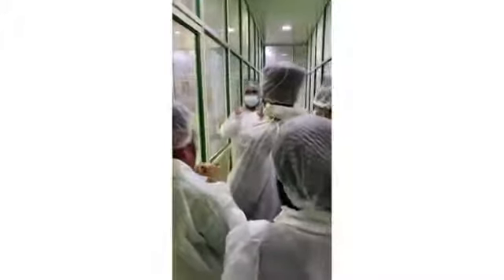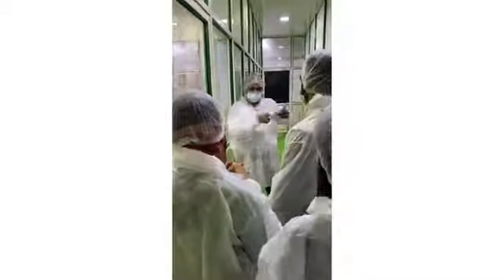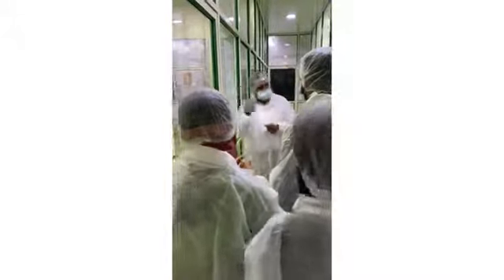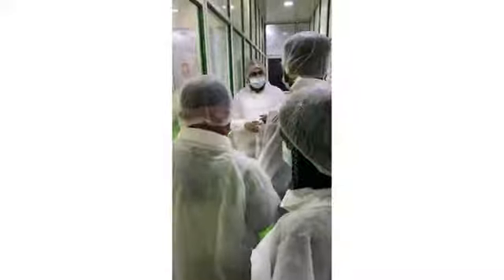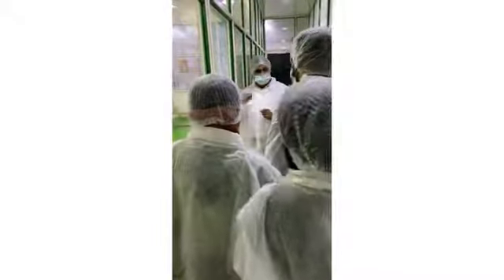We have to ensure that the food we are consuming is safe. How will the food be safe? How do we do it in our home? We bring vegetables from outside, we wash them, we clean them. The same way we follow here, the same as in our kitchen, what our mother follows. Then here it is advanced: we do some analysis and documentation.